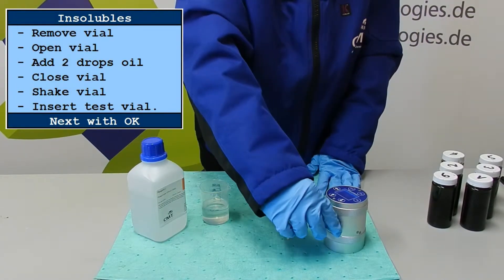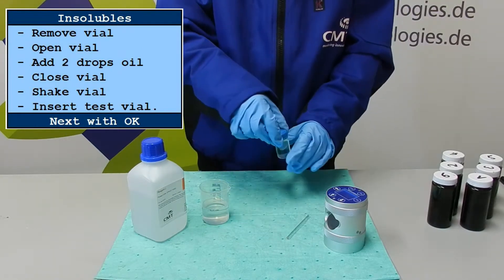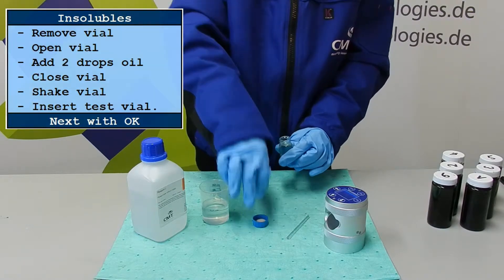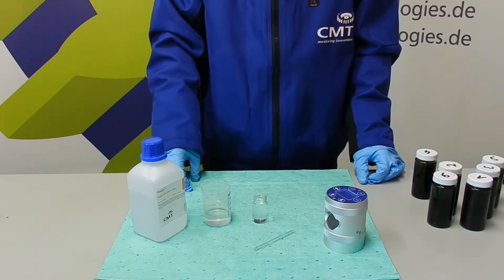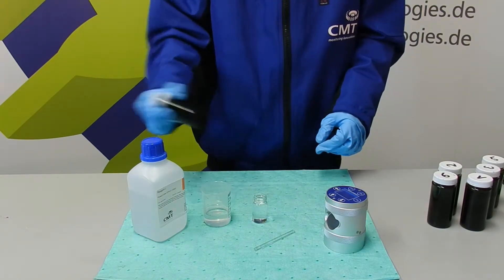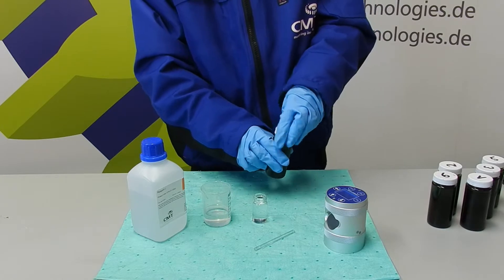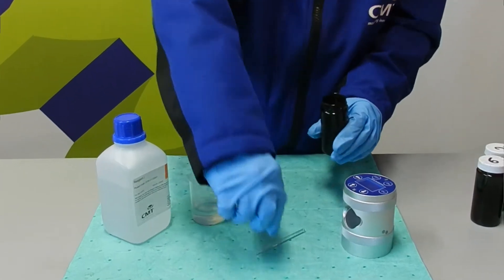Now remove the glass tube and open it again. Take the oil sample and shake it heavily to ensure a good distribution of soot in the sample. Open the oil sample and take the glass rod provided.